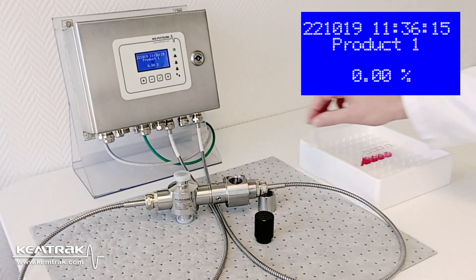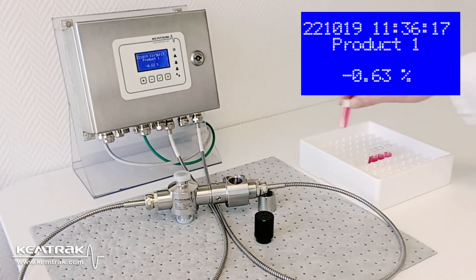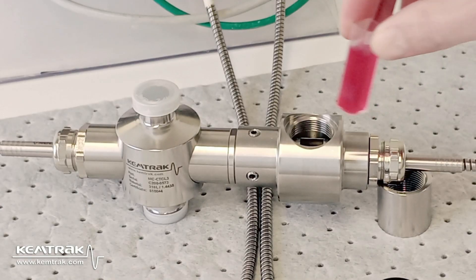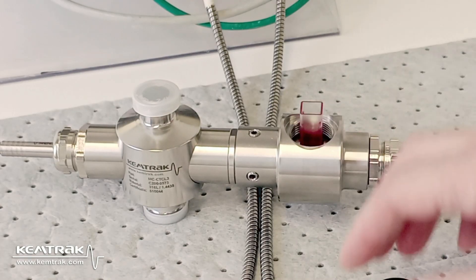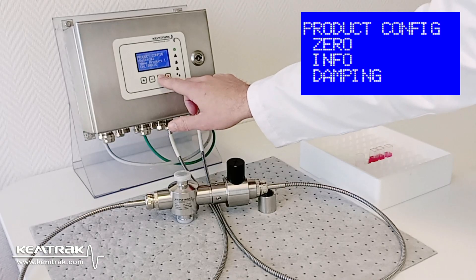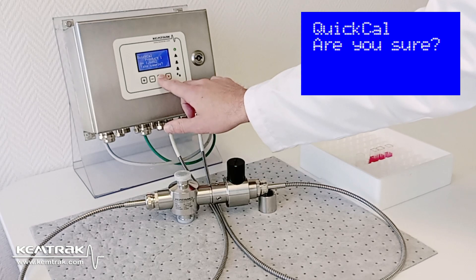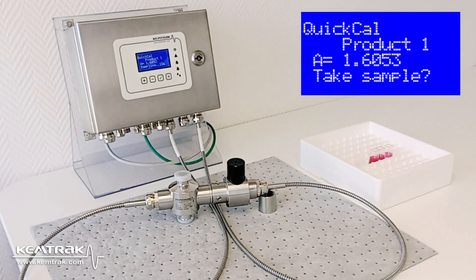Secondly, I calibrate the instrument using QuickCal with the solution at 100% concentration. This will automate a one-point linear calibration according to Beer-Lambert's law. Within Product Config, I choose QuickCal and press check to sample the corresponding absorbance value.